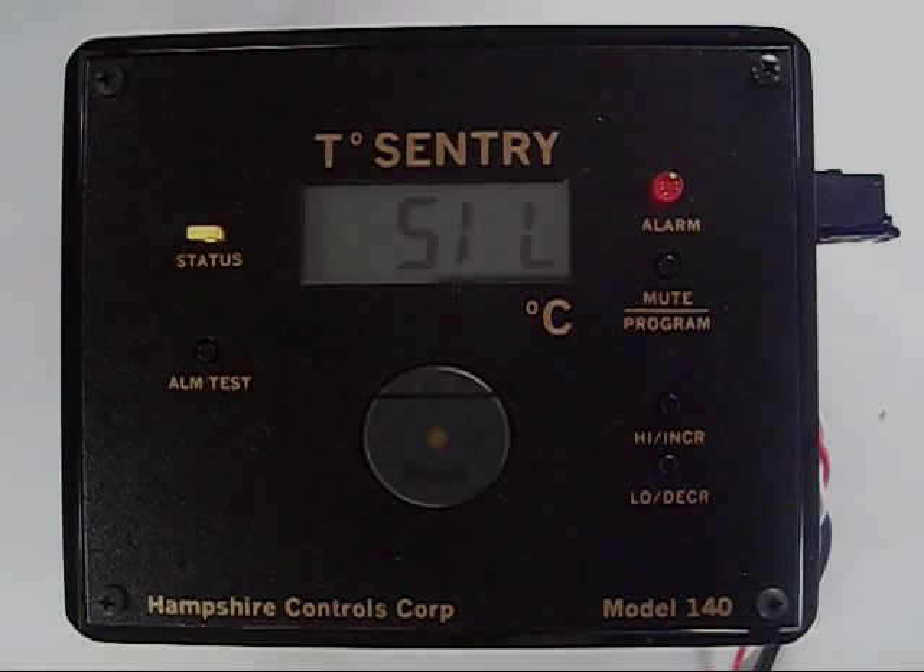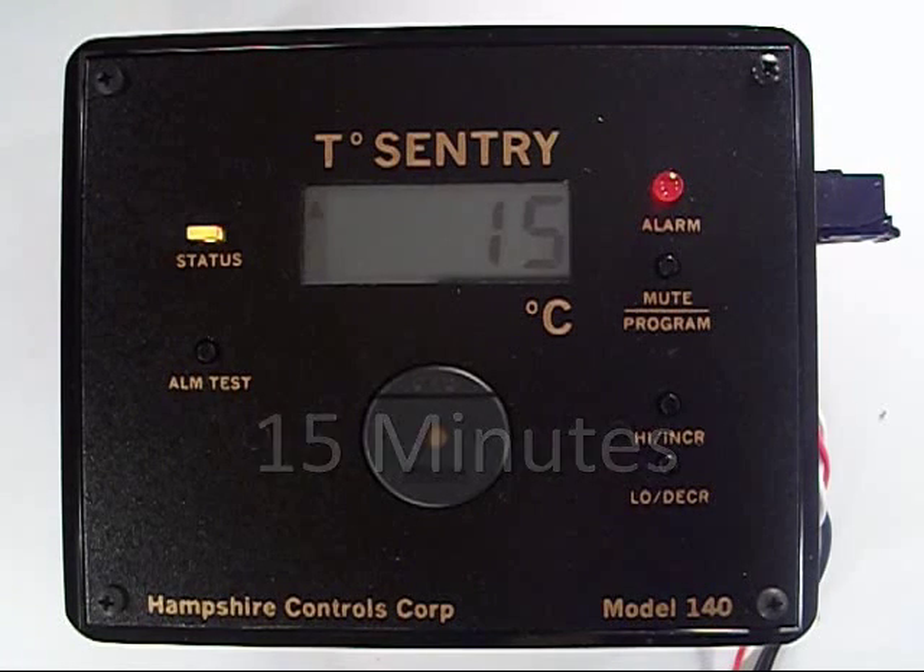Alarm silence. You may want to silence the alarm while you're checking things out. Set this for how long you want the alarm to chirp before going back to full volume again.